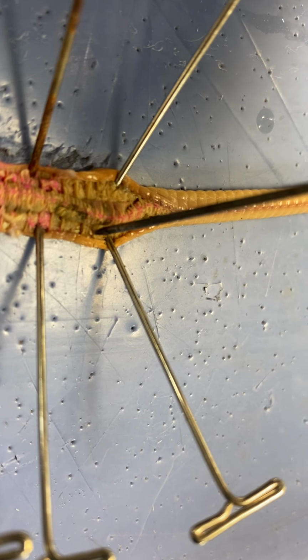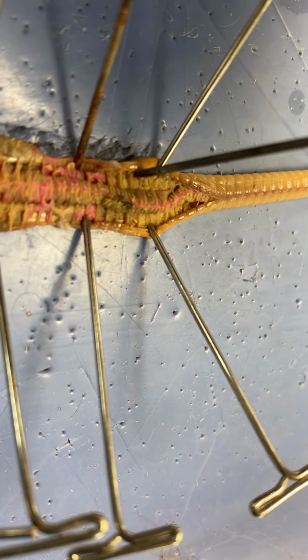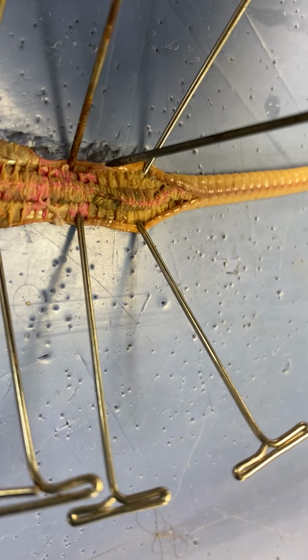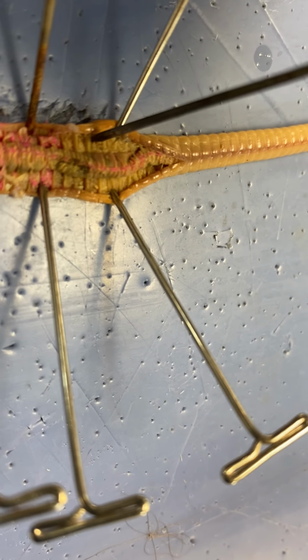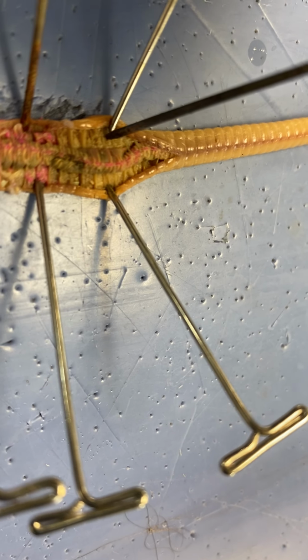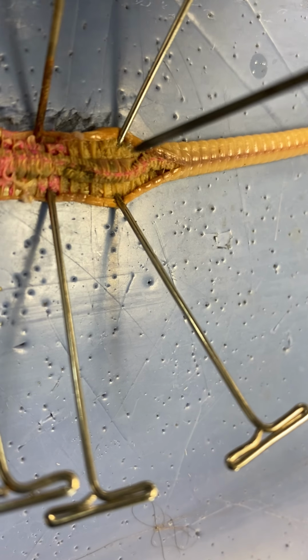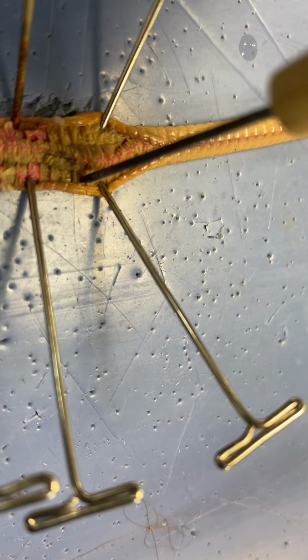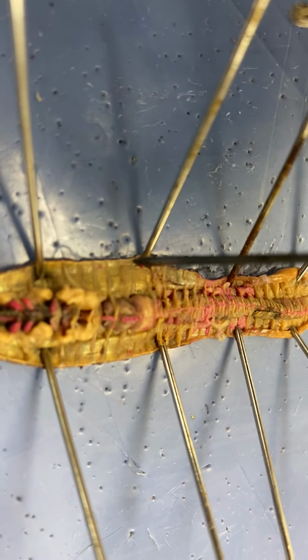These little things, I had to cut through them when I was cutting it open. These little lines in there are called septa. Not the setae, but septa. Septa are tissue dividers that create the internal segments and put the coelom into different segments also. So this is the internal segmentation, and what creates it is the septa. I had to cut through them to get it open. You can see it all the way down here too.